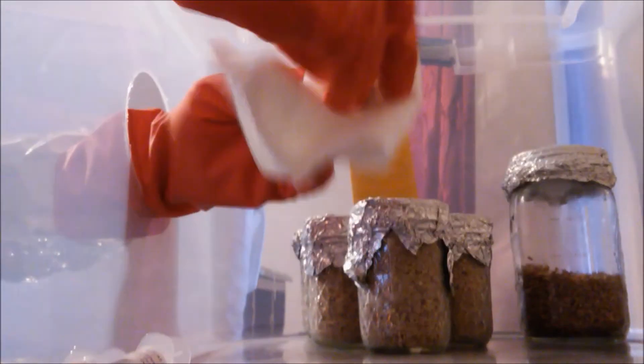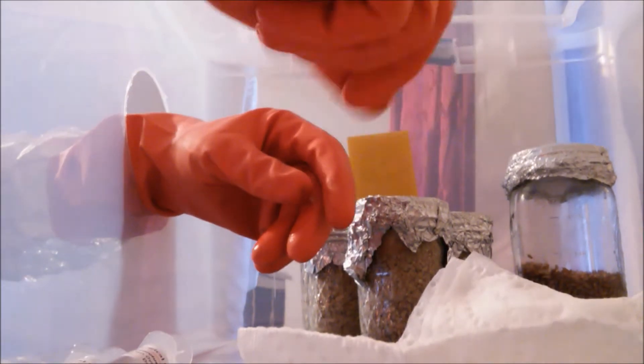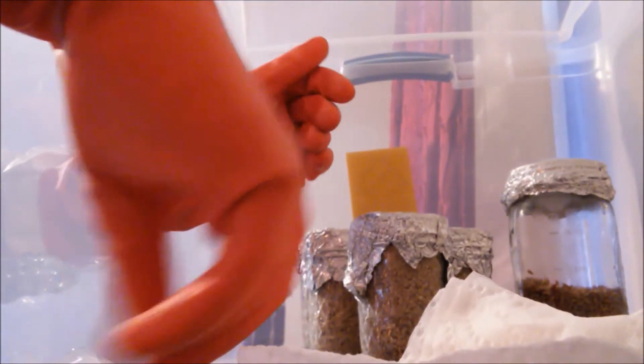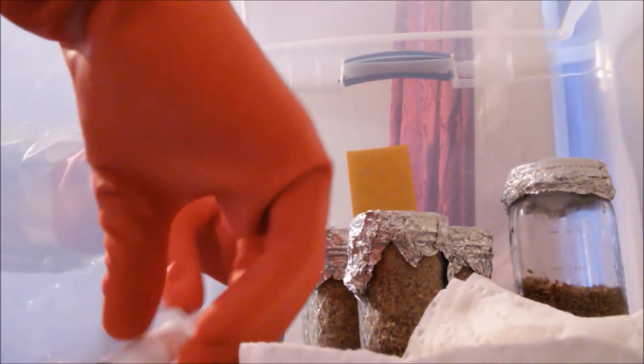We have a little thing here with alcohol on it. I can wipe my fingers off because I'm going to be taking this in and out as I flame sterilize my needle tips before I inoculate them.